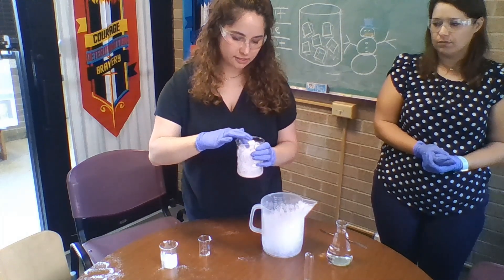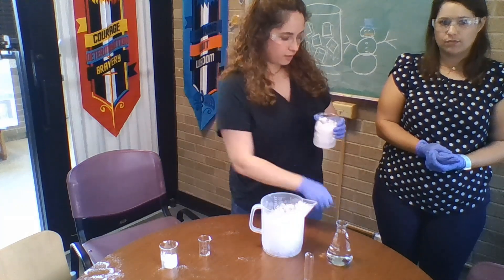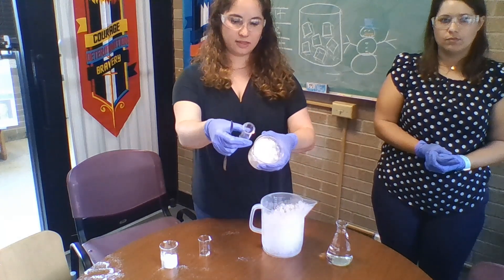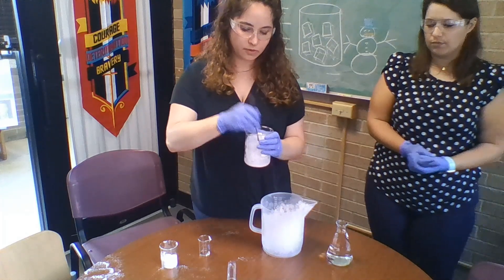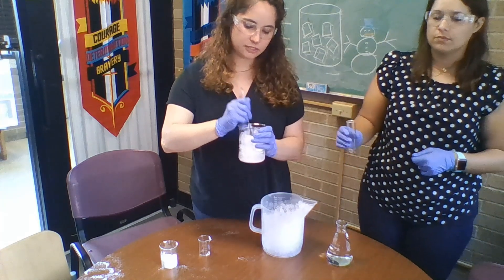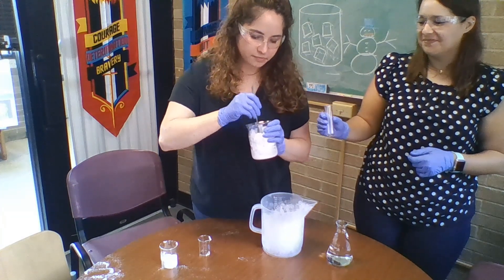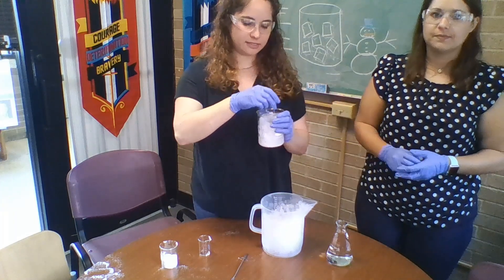The other thing about this is that if you've ever made ice cream at home you may know this, but once you put ice and salt together it kind of starts to get rock hard really fast, and you have to somehow squeeze this test tube into this ice bath, which is going to be a challenge. We don't want you slamming your test tube into the ice because it's made of glass — so that's not ideal.